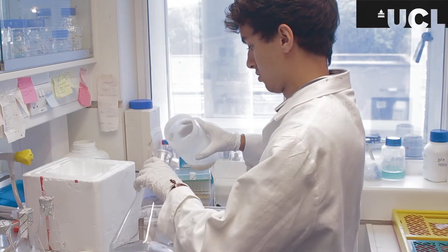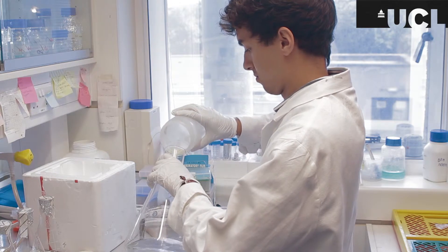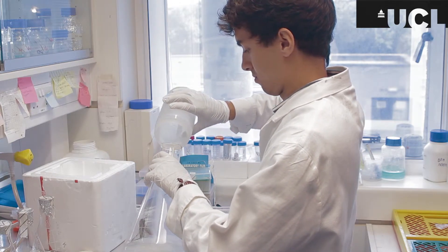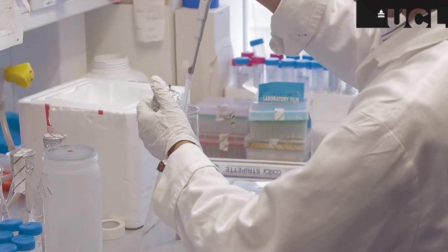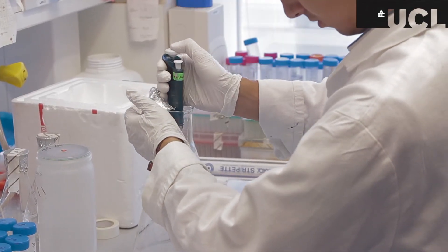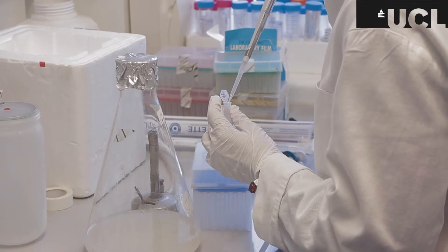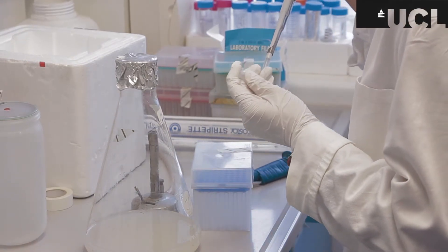Now the cells have been resuspended, just pouring it back into the media and that's ready to be induced to start the expression test. Just taking a stock there about a mil just to run another optical density experiment just again to assess the growth.